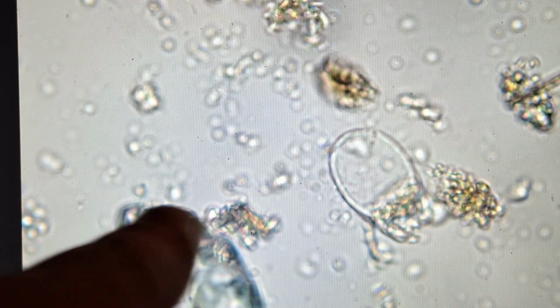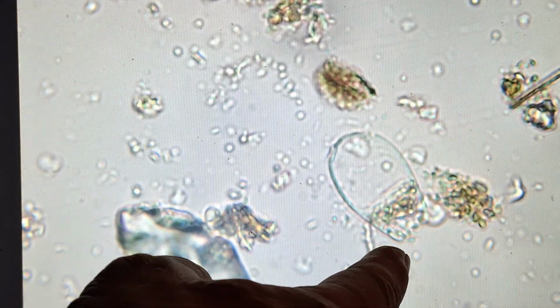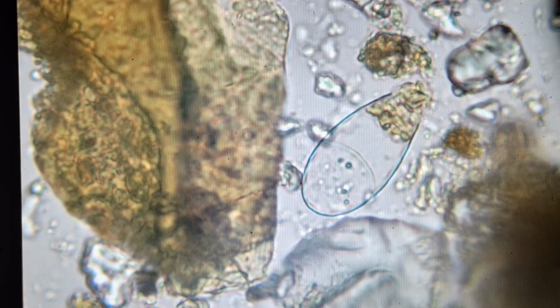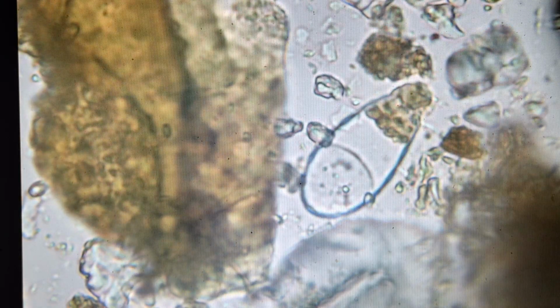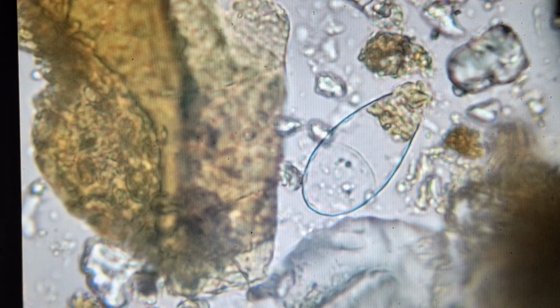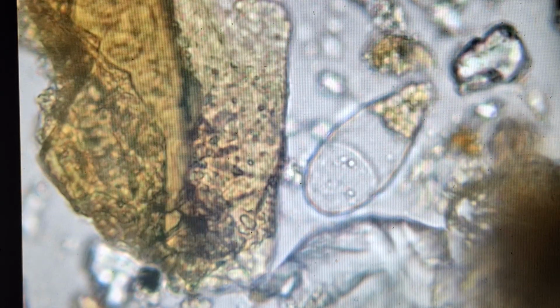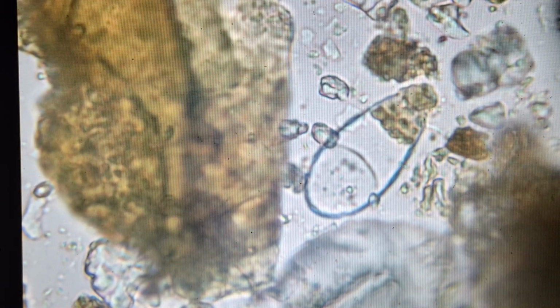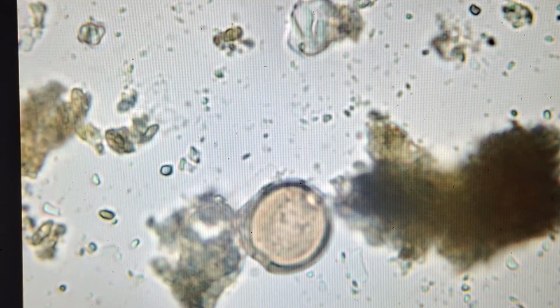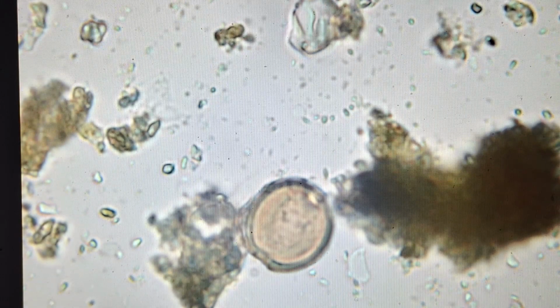You see the shell, it's a double wall going around the outside of it here. You see the mouth on this end. Probably see a few more in here. I don't have to go far. There's another one right there. And we can see the shell around it and its innards. These are organic matter in front of its mouth. We can see the shell on this one very well. Another type of amoeba, a very good sign, an excellent nutrient cycler. This is an Arcella amoeba.